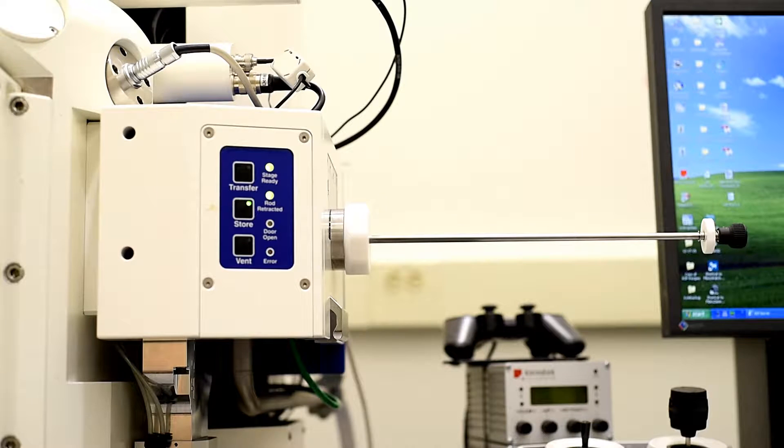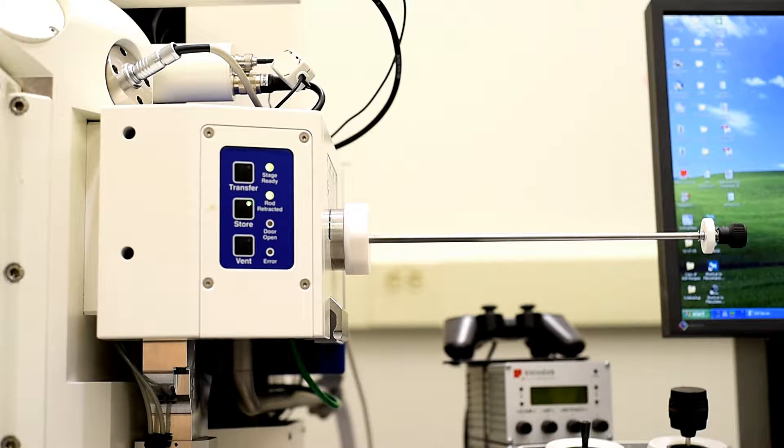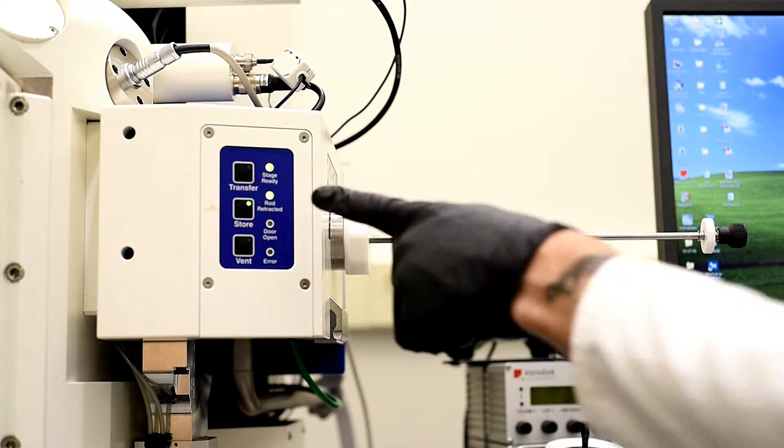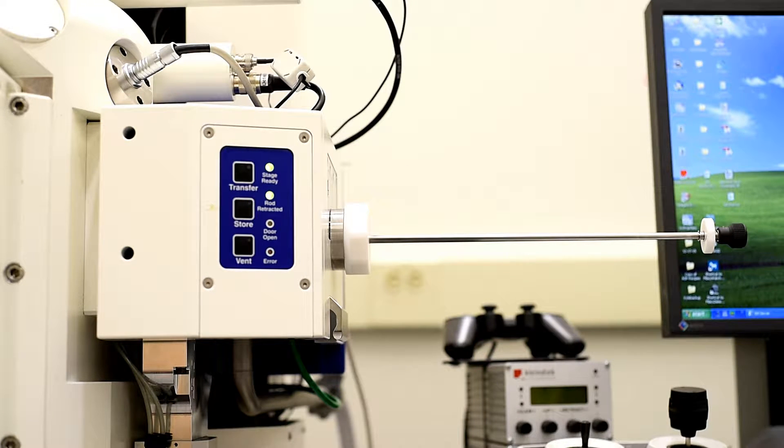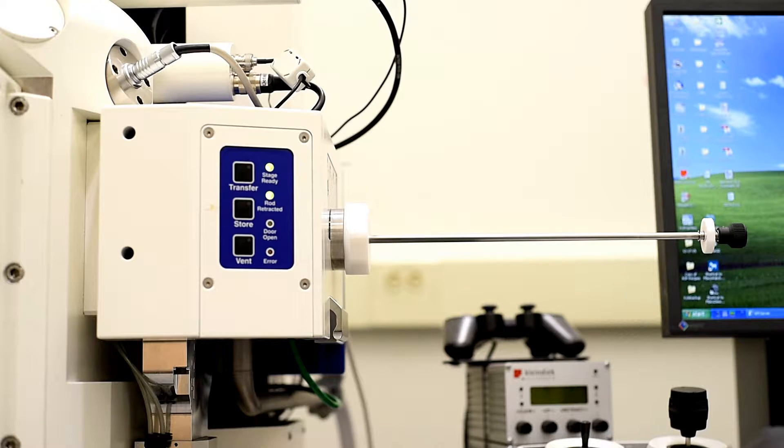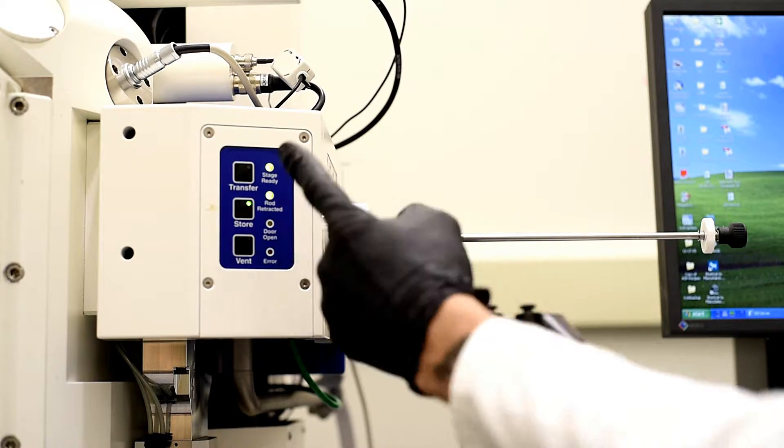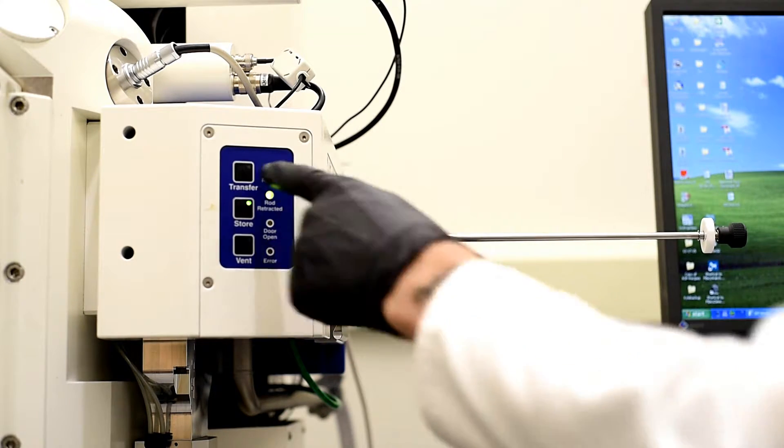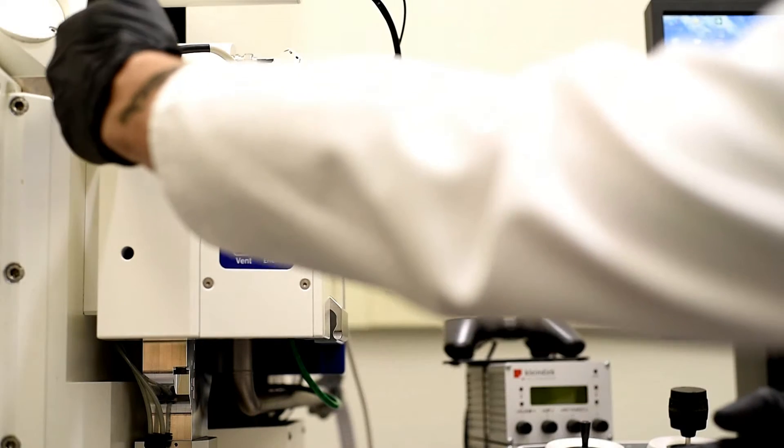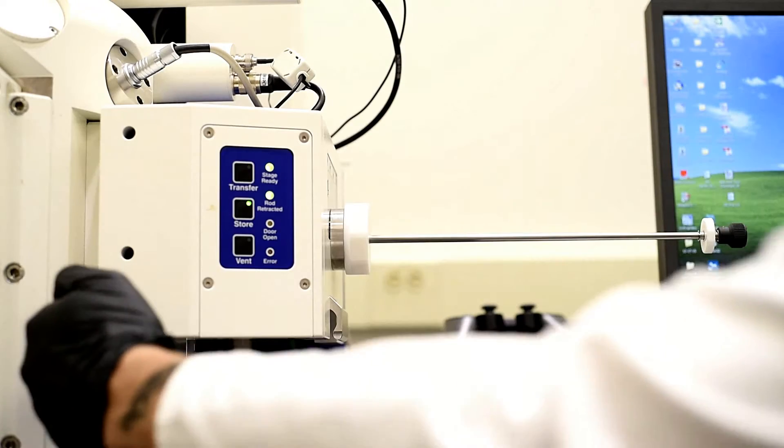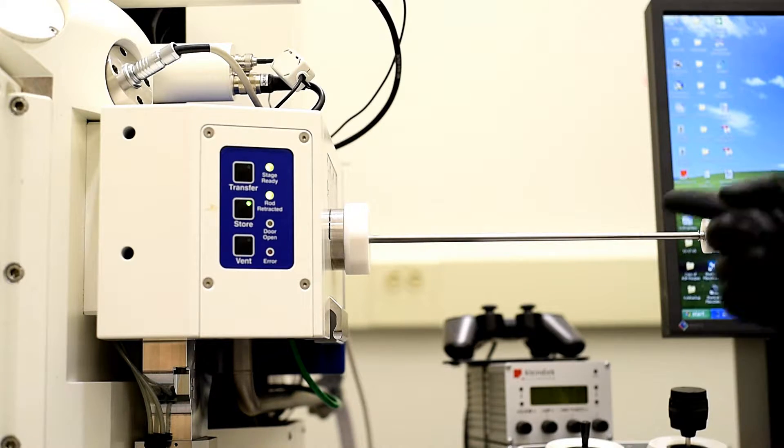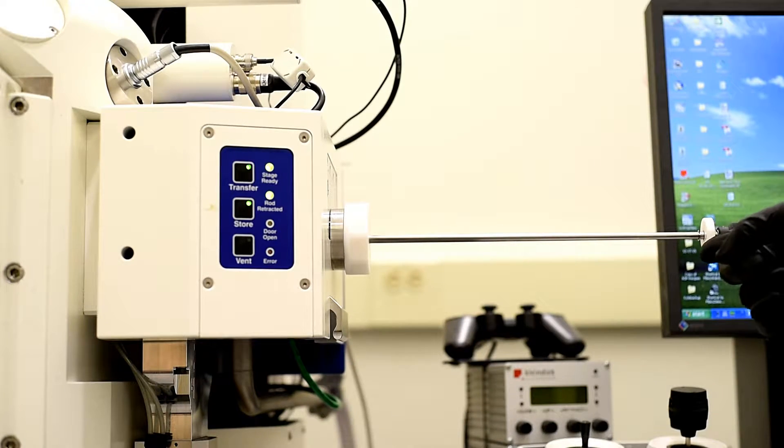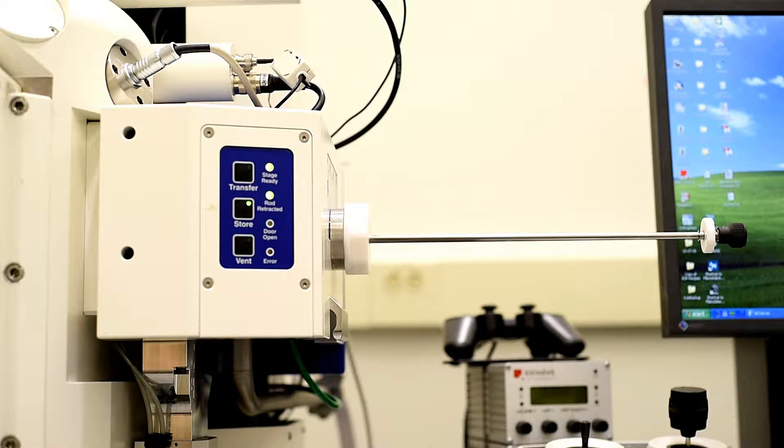That will bring us back under vacuum. Once that remains solid light, we'll click transfer. So at this point it's solid, I can hit transfer, we're under vacuum, so there's a little door that will drop down and we can move our sample from point A to point B.